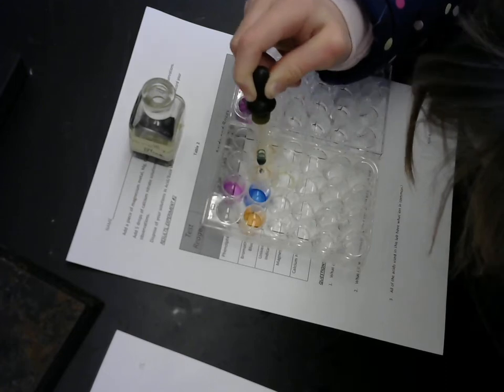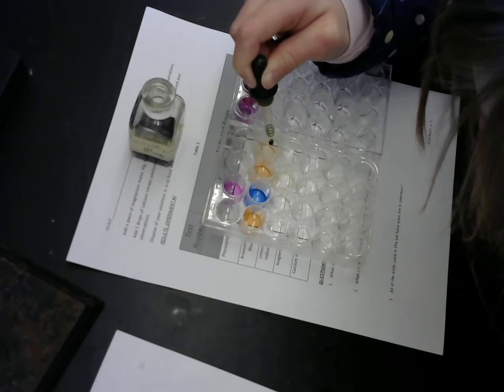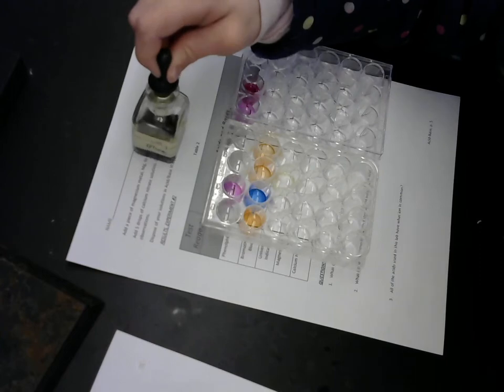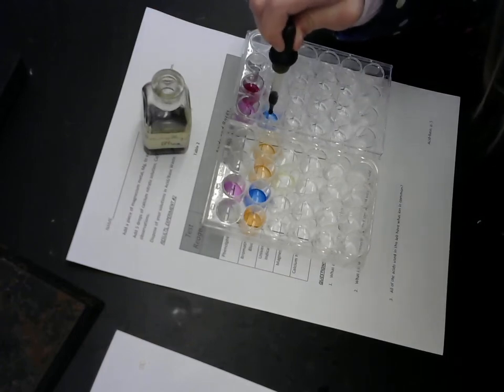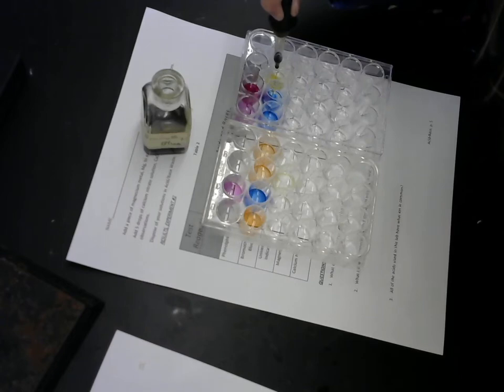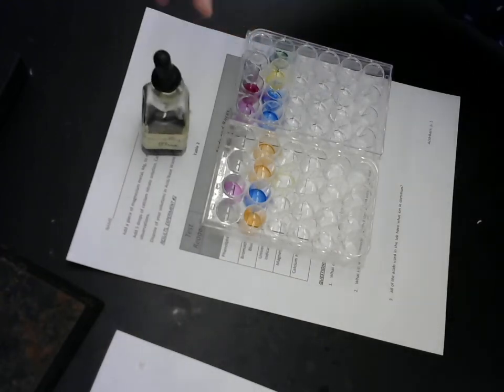Knew it. I'm like, there has to be some green in this, right?